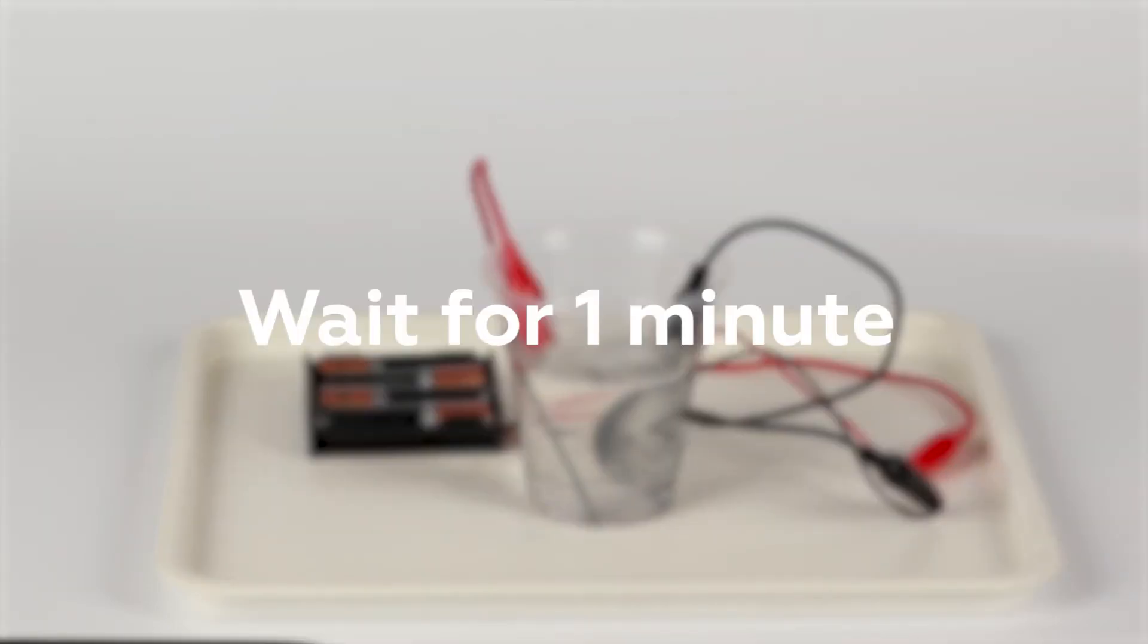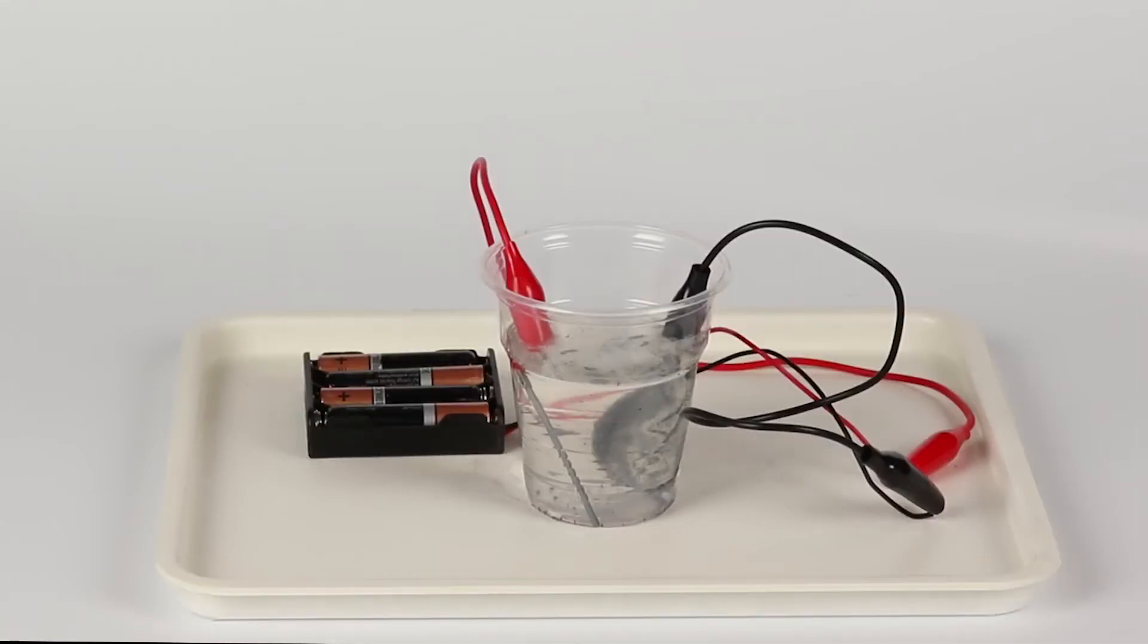Under the action of the electricity, the positively charged zinc rod dissolves, enriching the solution with zinc cations.